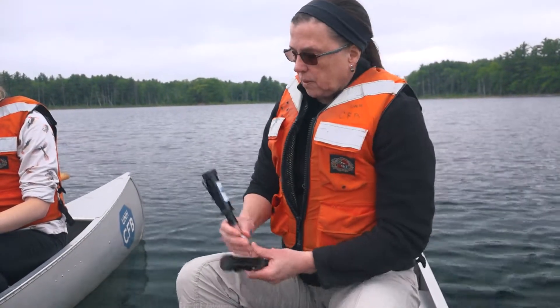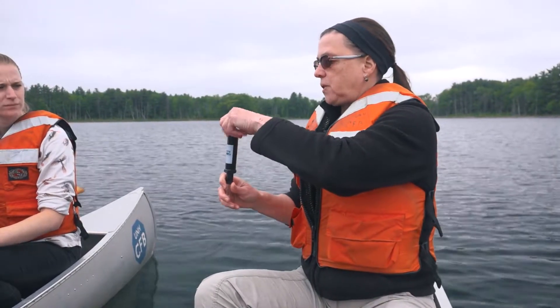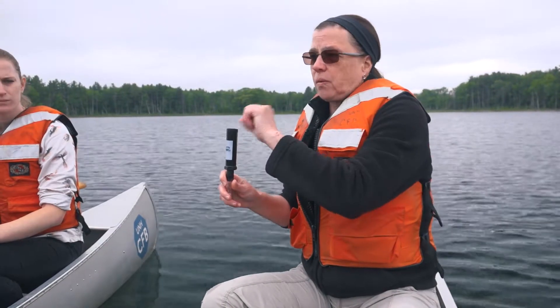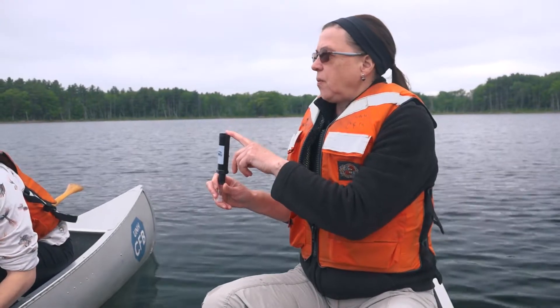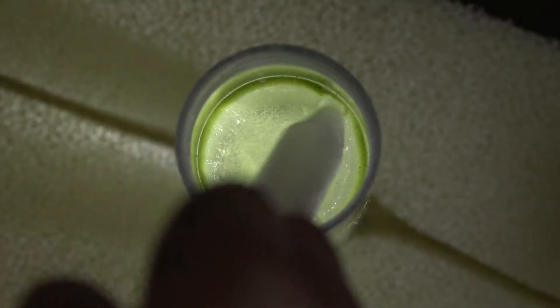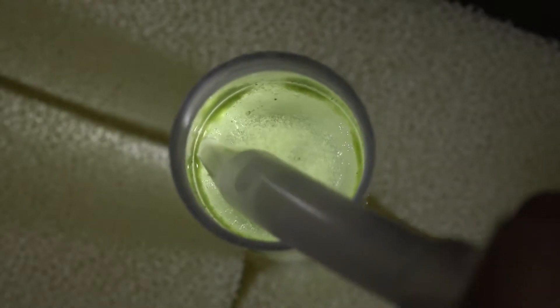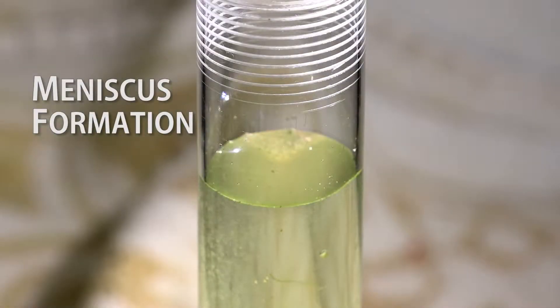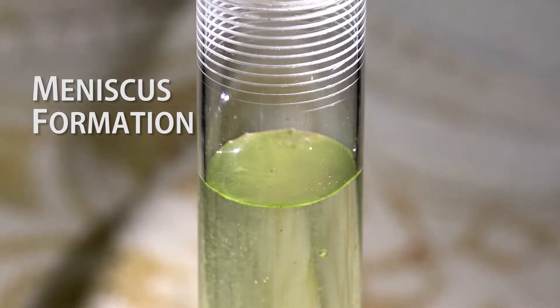But if we have them in our little pocket zappers, they actually form — we take the top off and they form a little meniscus up at the very top. So that's what we're going to be doing later: we put our net plankton sample in here, we allow it to separate for 30 minutes, and then you're going in with a pipette and you're just taking off five mils of total sample off the top because it forms this little meniscus on the top.